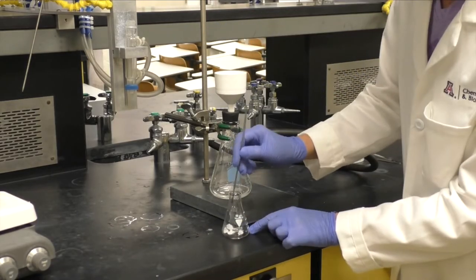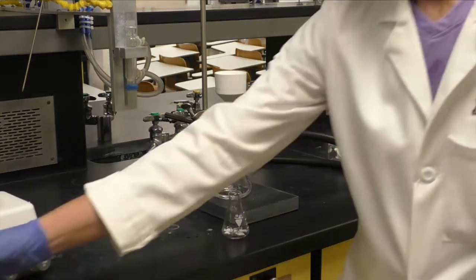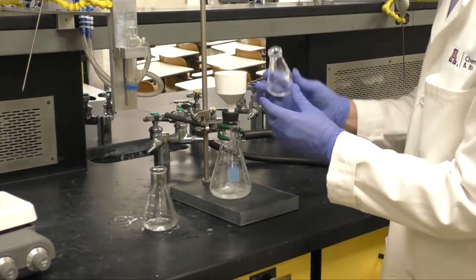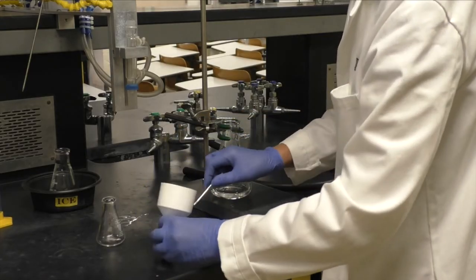If necessary, break up the crystals and use more water to collect all the crude product. Allow the vacuum to run for about 5 minutes to ensure the product is dry. Weigh the crude aspirin and record the mass.